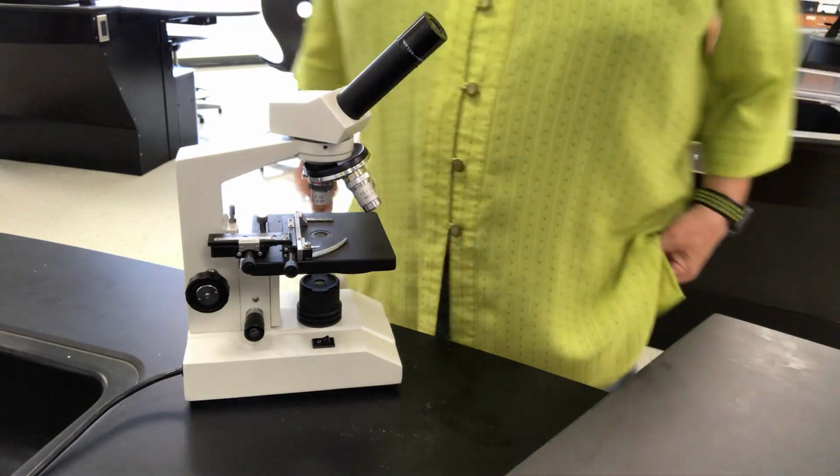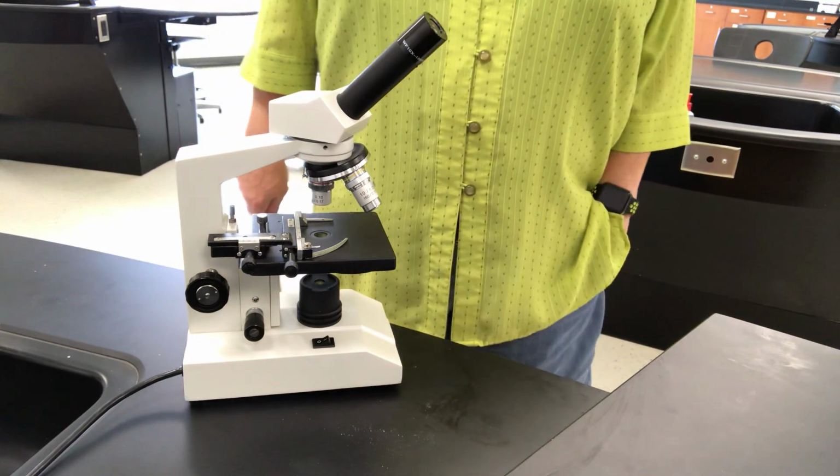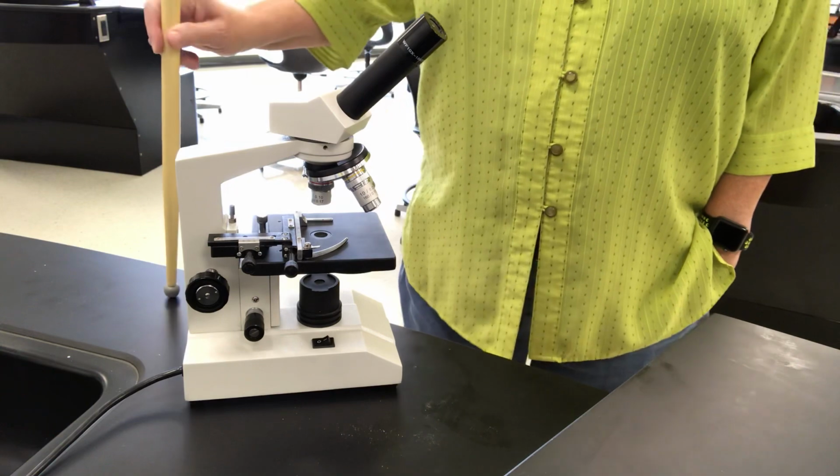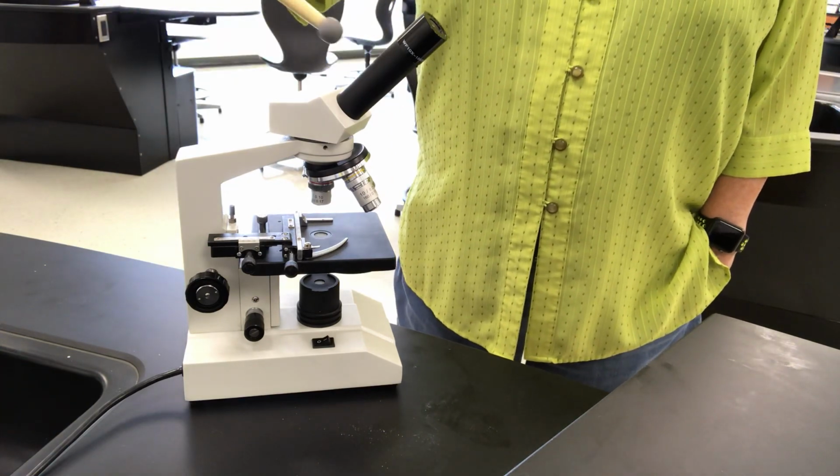Good afternoon. I want to talk to you about your microscope. We're going to learn the parts of it. I made a video so you can start and stop it. Use my handy dandy pointer here.